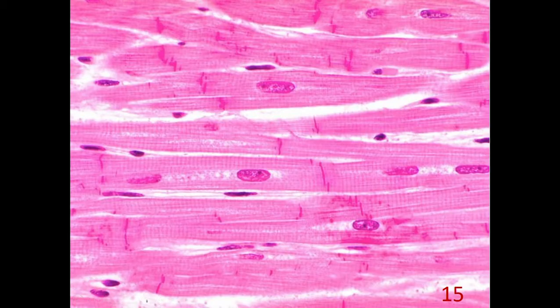In these longitudinal sections of cardiac muscle, long cylindrical shaped myofibrils with a centrally located nucleus are observed, and between two myofibrils there is a discus intercalaris to connect the fibrils for synchronous contracting and relaxing.